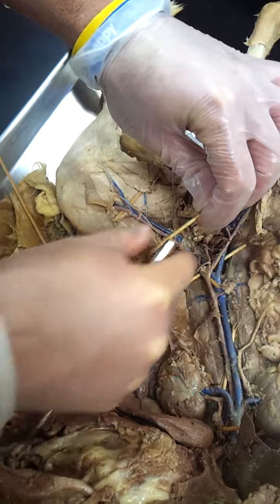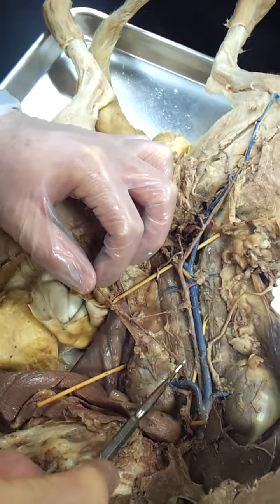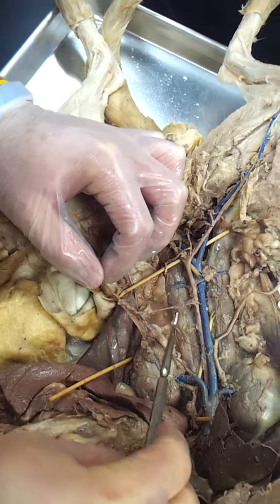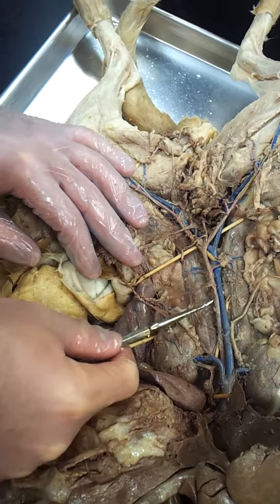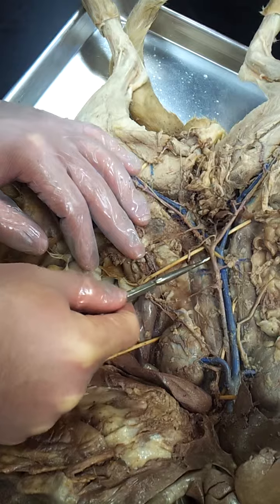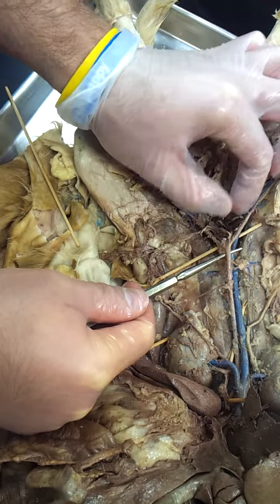And then here, I've kind of pulled the mesentery apart, but if we try to put some tension on this, you can see one artery traveling superiorly and one attaching inferiorly. Those are going to be your superior and inferior mesenteric. And this giant trunk here, descending aorta. Once it heads down here and branches off into two branches, what two main branches do we have on the outside? External iliac artery.